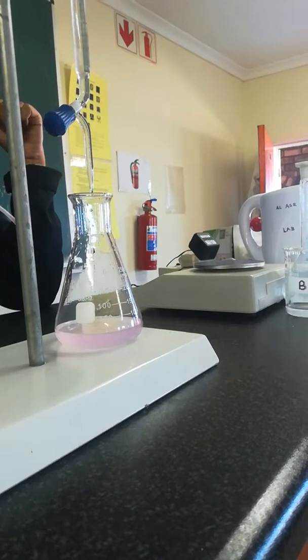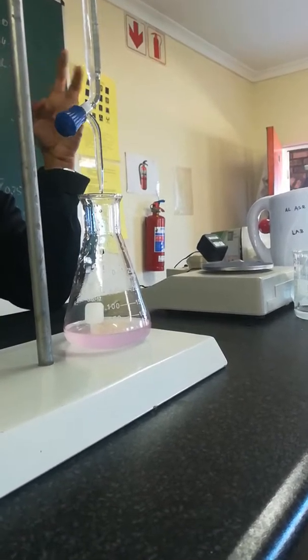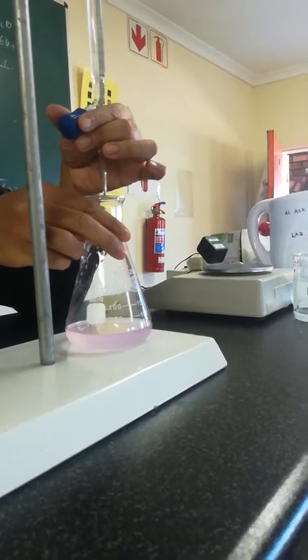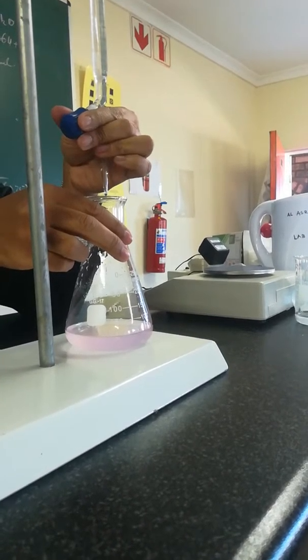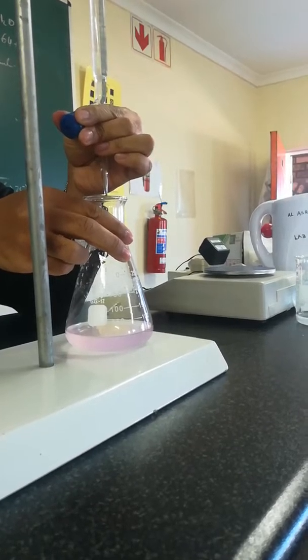Let's try one more drop. Sometimes one drop won't make a difference, but two or three. We're going one drop at a time. Can you see why it's important to hold it like this? To control that drop.